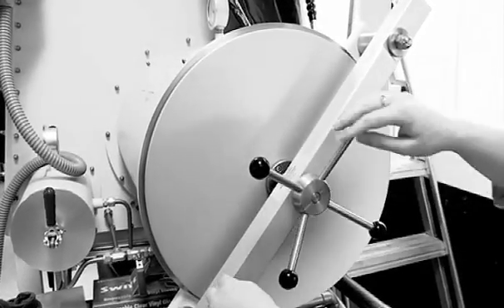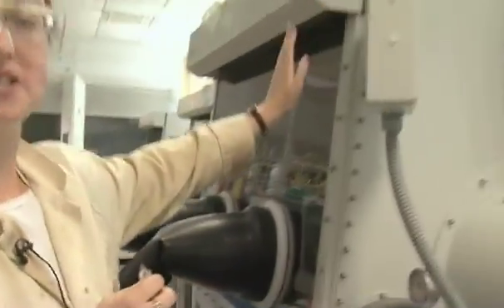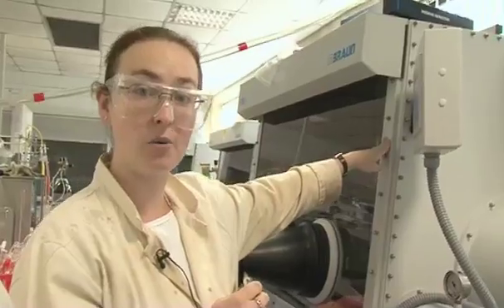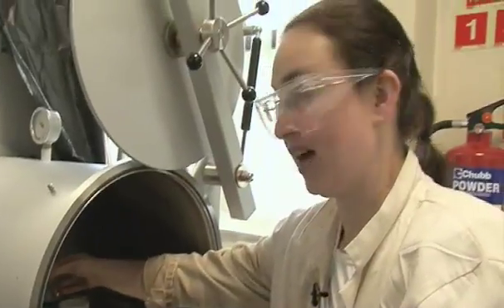So what I've been asked to do today is take this ampoule of caesium into this piece of machinery here, which is one of our glove boxes. Hopefully nothing will happen if it pops.